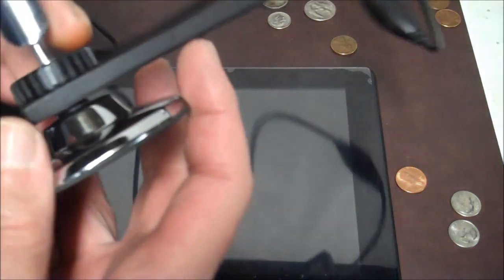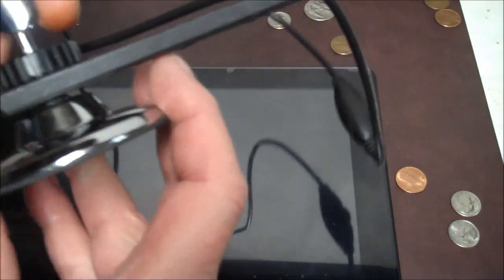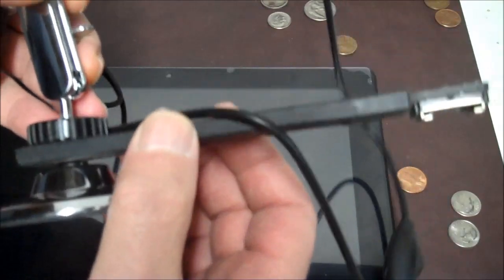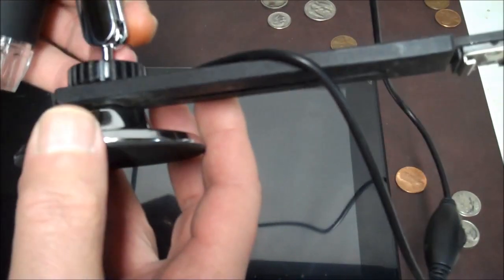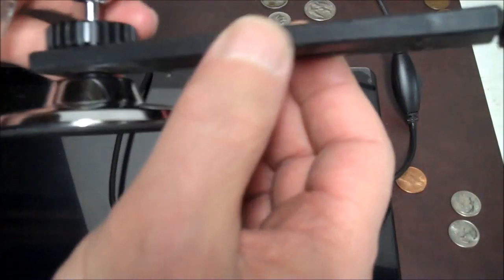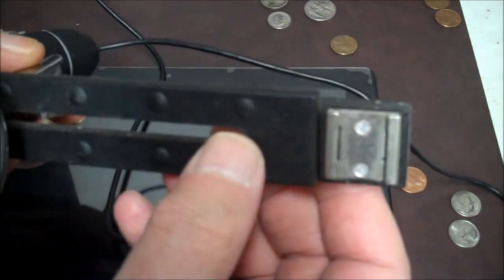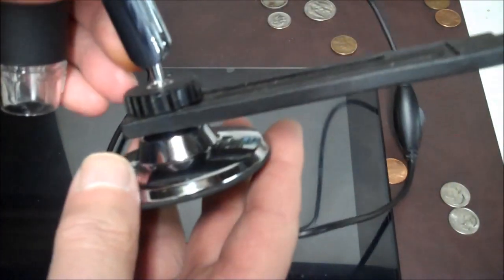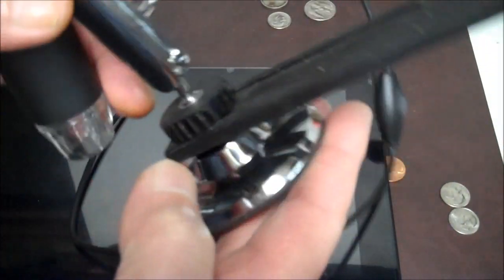This stand that it came with, it's too light, okay? So I added this bar back here. This is like a flash extension, see? And what it does is the counterbalance keeps it from falling over.